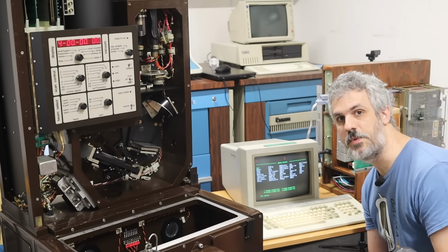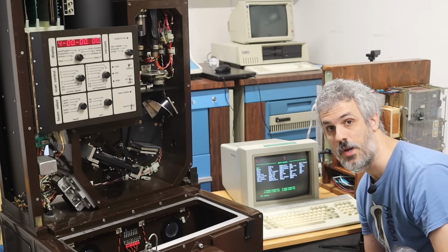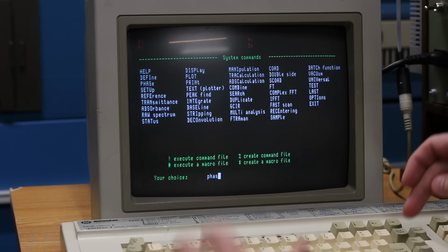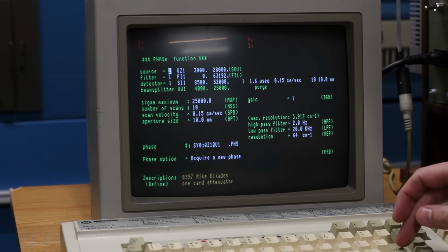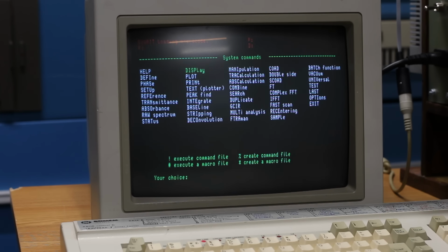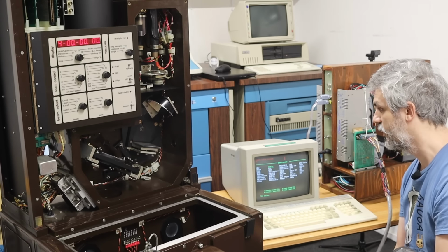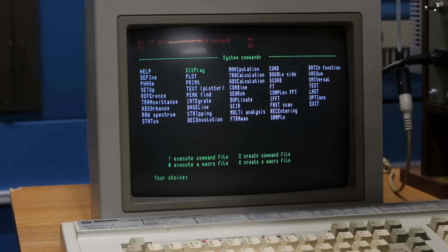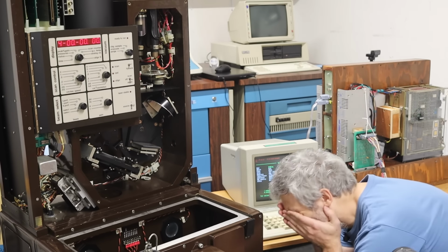All right, back in the menu program here. I'm not confident because I think that thing should be changing modes the moment that we get into the menu program here. But I don't know, let's give it another shot. We'll do PHAS here for phase. It's gonna load up a bunch of stuff. We'll go ahead and just tell it to run that. It's gonna load a bunch of microcode. And as soon as it gets done loading the microcode, it should fire off a serial signal over to the Bomem. Hopefully down the right wires. Nope. Same VP error, -6 on send command. Oh man.